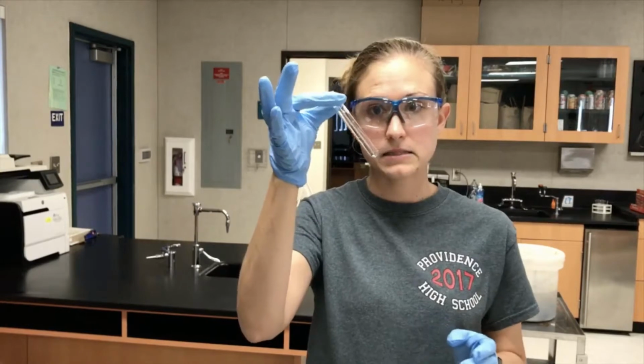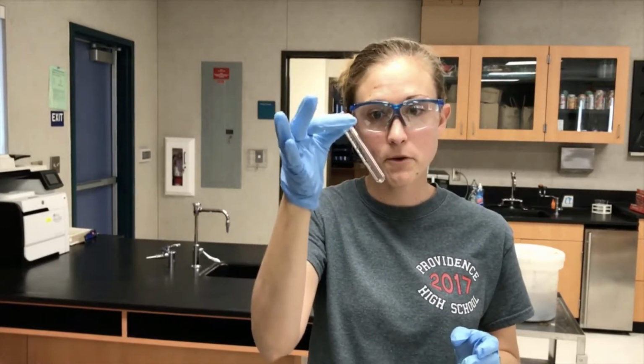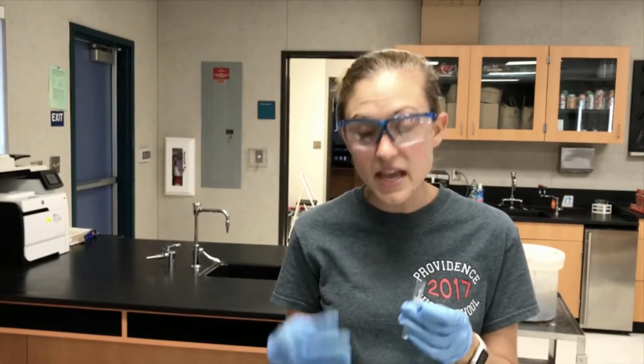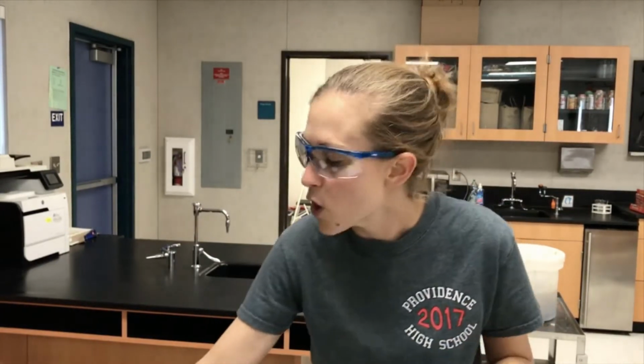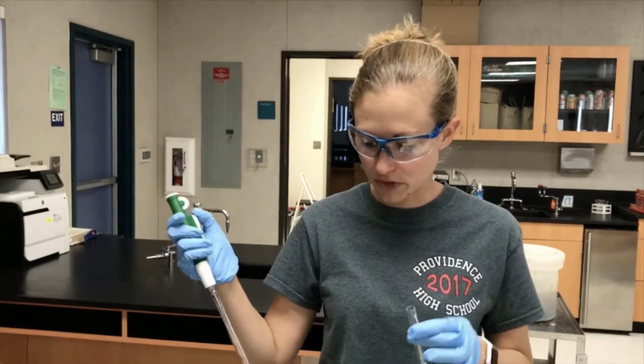Okay, so these are glass, be careful with them because they can break. Now, I'm going to fill one of them with water, and then the other 5 are going to have solution. Well, I can add the 0.4 molar solution really easily and not have to do any calculations or any work. So what I'm going to show you is creating the 0.2 molar solution.